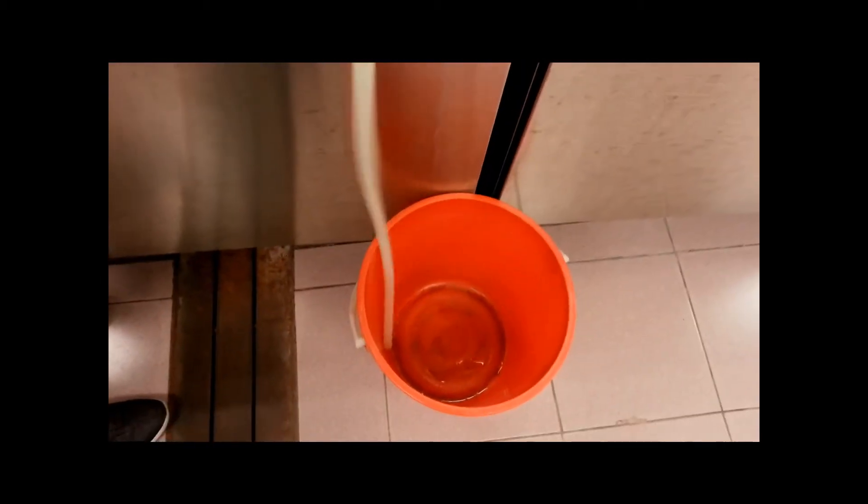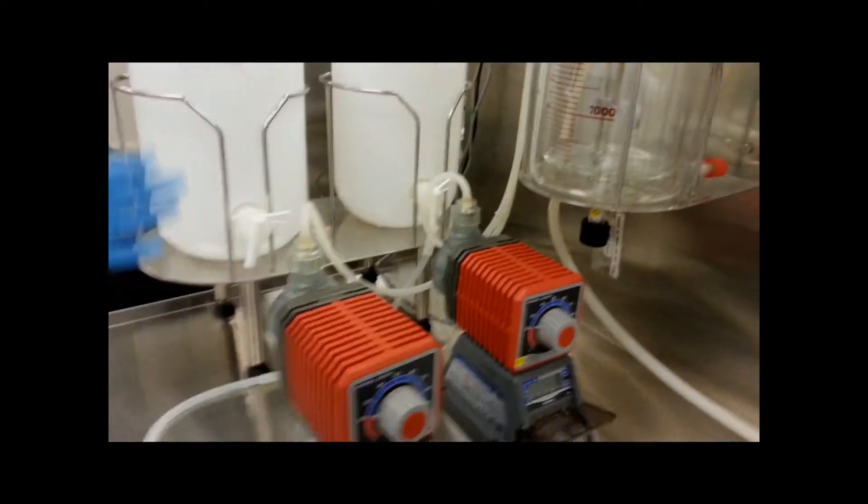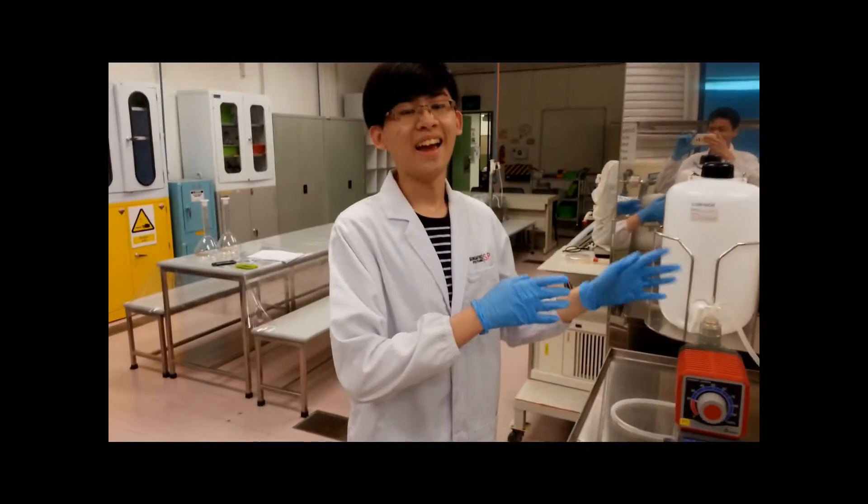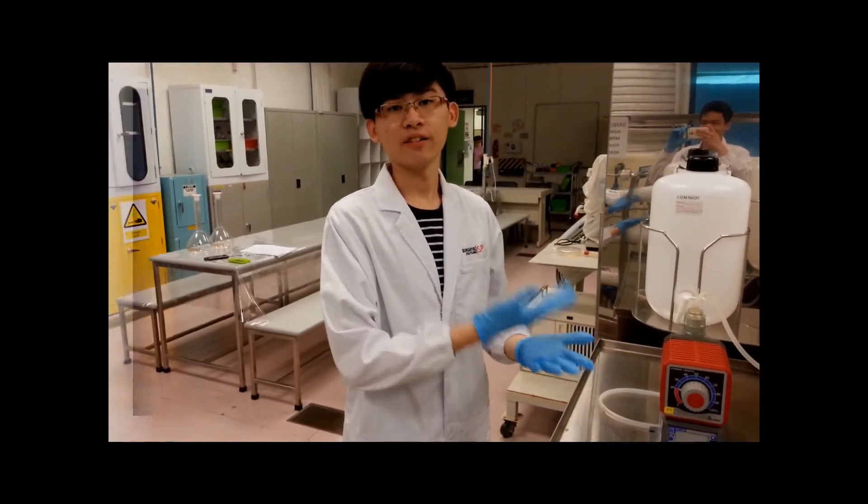Following that step, you are required to drain out all the solution from the reactor using the drainage valve. After this step, just do proper housekeeping and this is the end of the experiment.